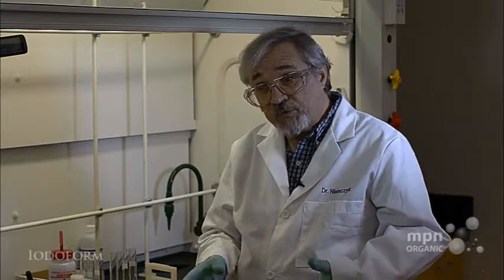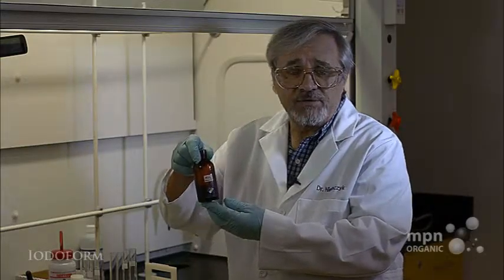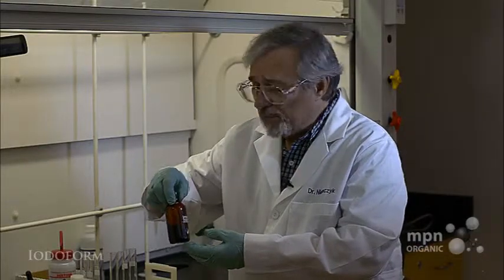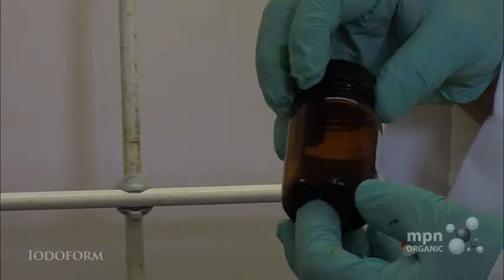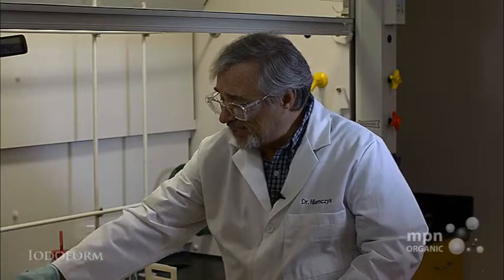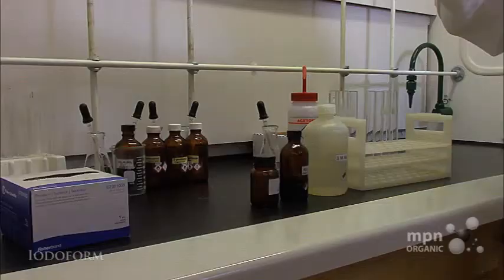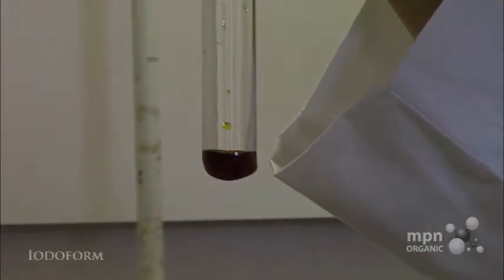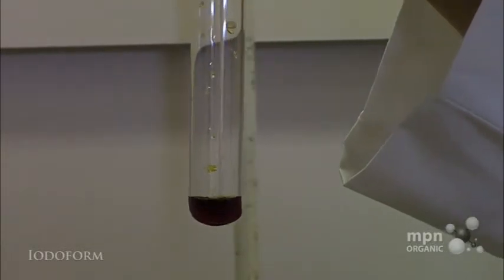It's really a very simple test to perform. What you have is a solution made from potassium iodide and iodine. I took the liberty today of mixing some iodine crystals, which are water insoluble — we have a bottle of them here — with some potassium iodide solution, which has a slightly yellowish color. When you mix these two together, the KI and I₂ reagent takes on a very dark orange-brown color.